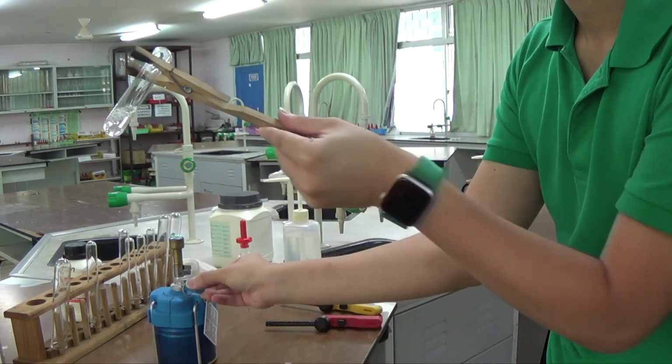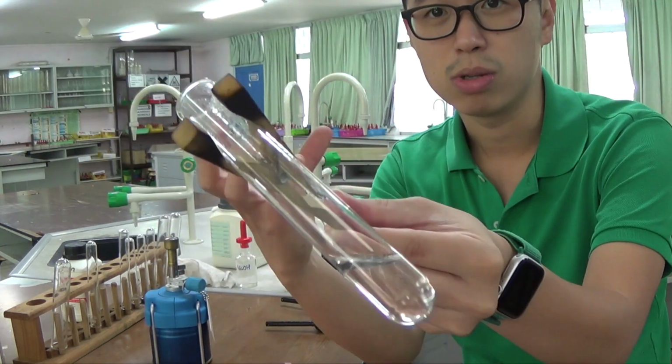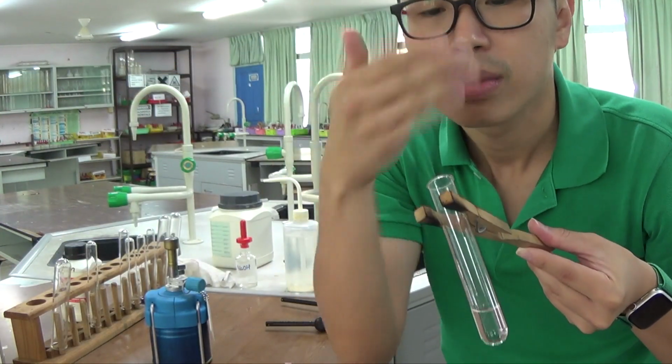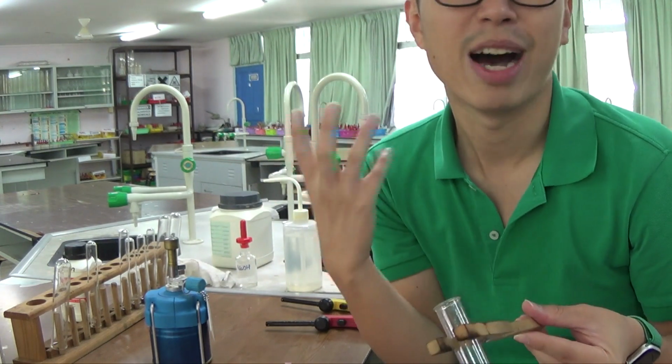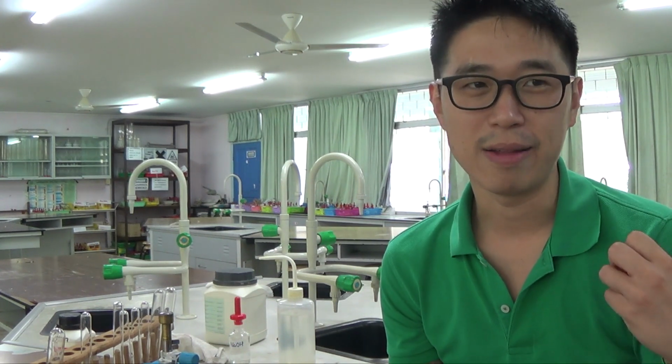So what we are saying is you get a little bit of bubbles because there are gases given off. It doesn't require you to boil it entirely. There's a little bit of gas being given out. You can smell it. The gas smells really pungent. It smells like urine, because ammonia is a gas that is produced when you urinate. That's how your body breaks down nitrogen in your food, and that's an important process. It's part of the biological cycle for your body to produce urea, which will break down on its own into ammonia.